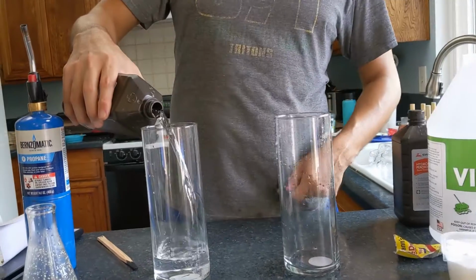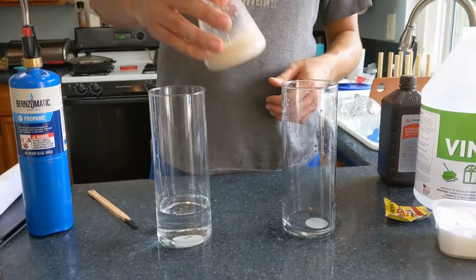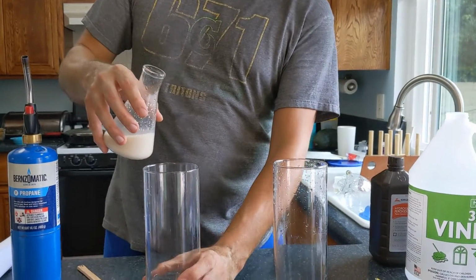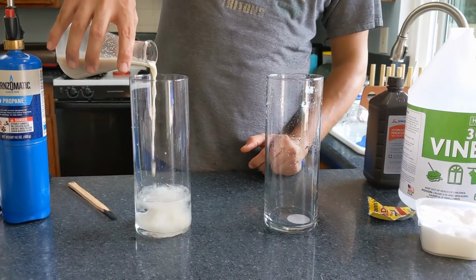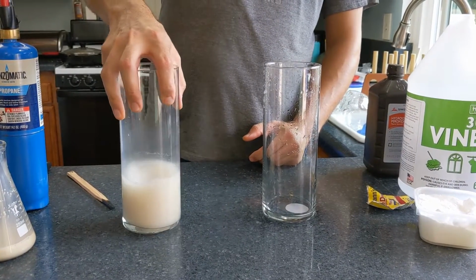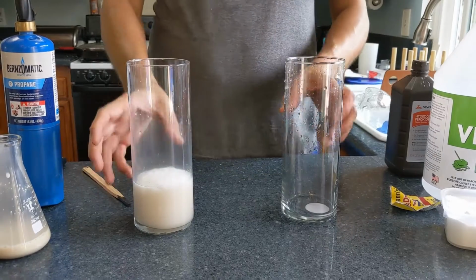This is hydrogen peroxide. This is a compound that's made up of hydrogen atoms and oxygen atoms. And this right here is a solution of hot water and yeast. This has an enzyme that's going to cause a chemical decomposition of the hydrogen peroxide, which is going to release the hydrogen and oxygen atoms. So we'll see right here, you'll start to see some bubbling. And what's going to come out of this decomposition is oxygen. So those bubbles are oxygen that's being created there.